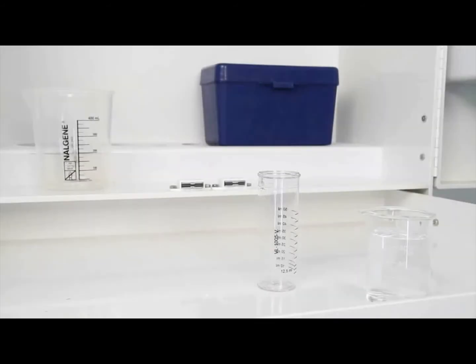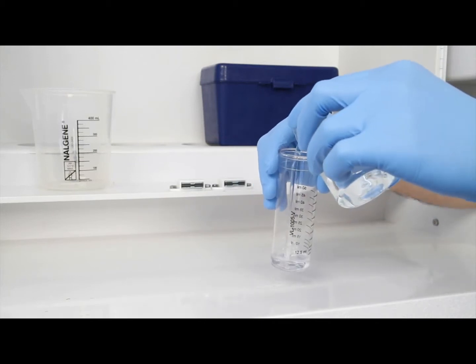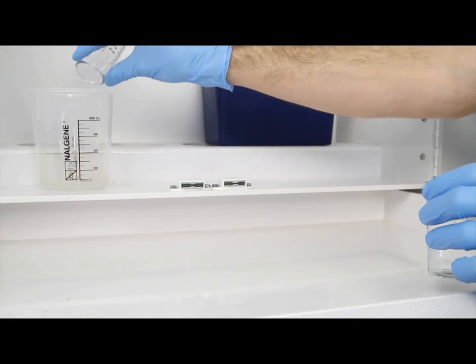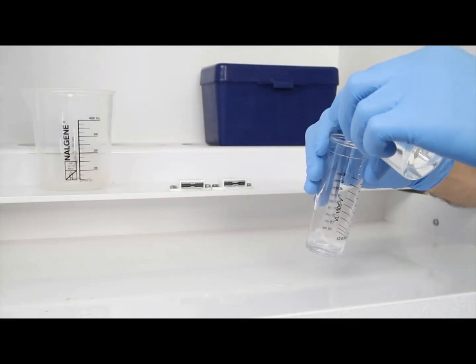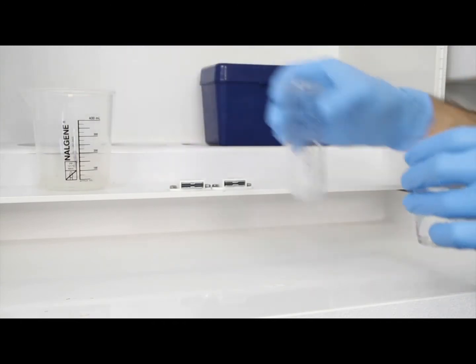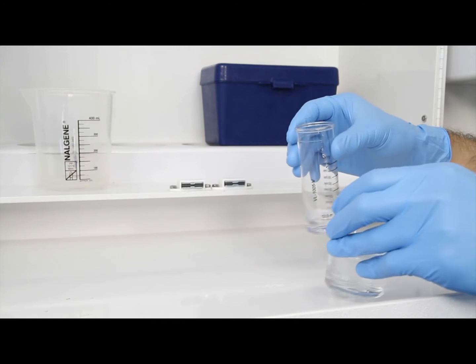The first step according to the endpoint ID procedure is to gather an accurate sample. The smallest change in sample size will lead to inaccurate results. Before gathering your sample, it's important to rinse the vial 3 times with the sample to be tested. This minimizes the chance of contamination from a previous titration.